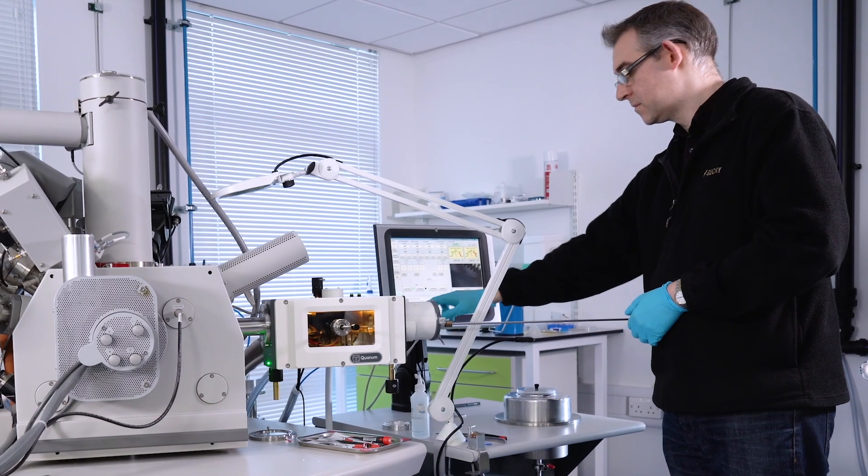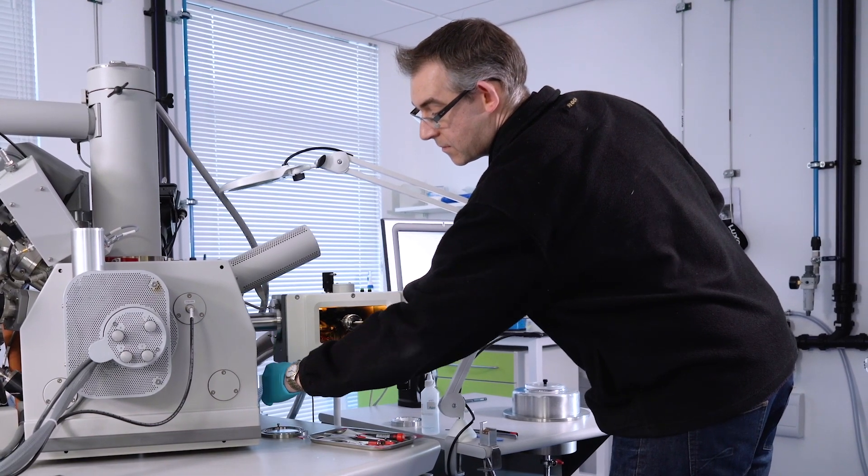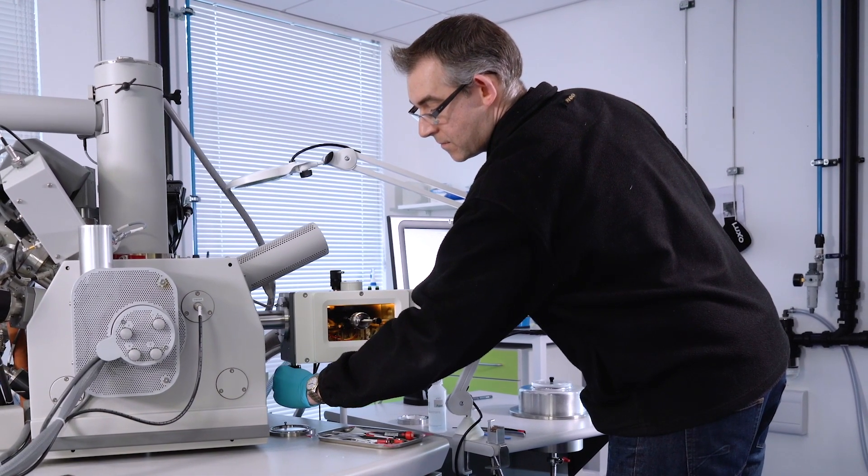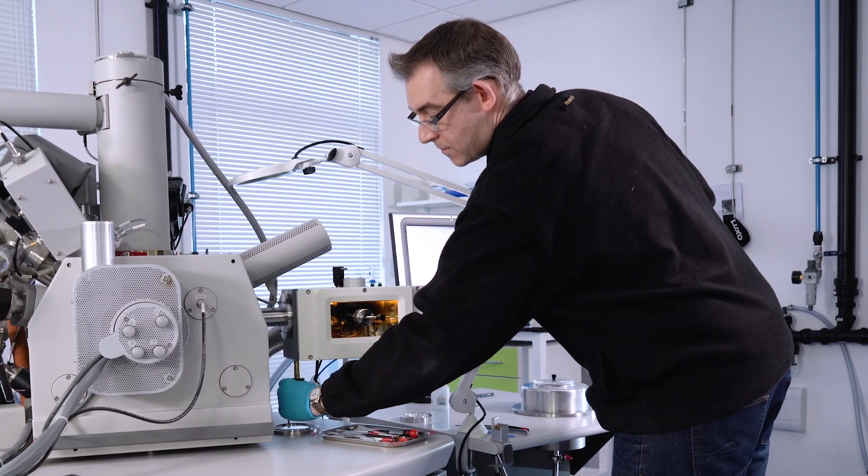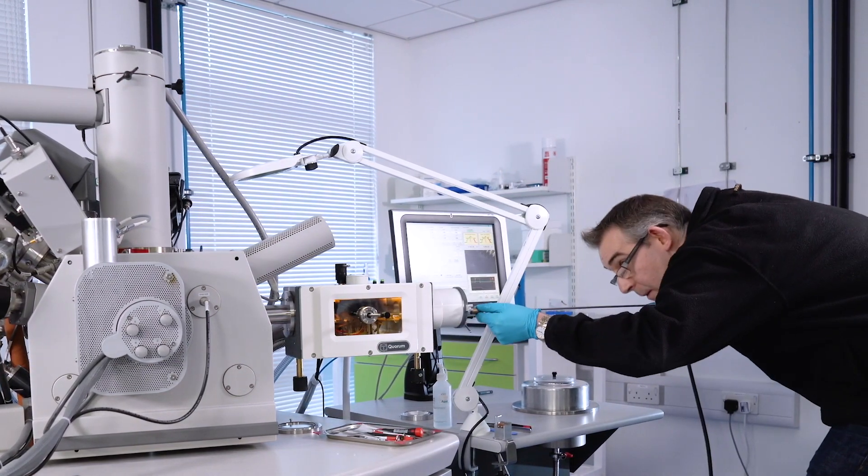So once the sample has been fractured, sublimed, and coated, we then press the transfer button to enable the SEM valve to be opened and we transfer the sample into the SEM cold stage.